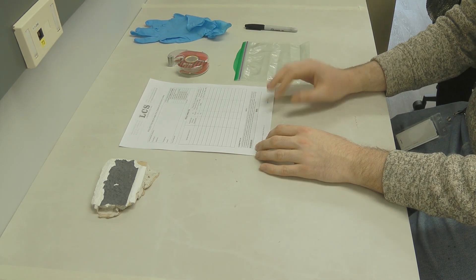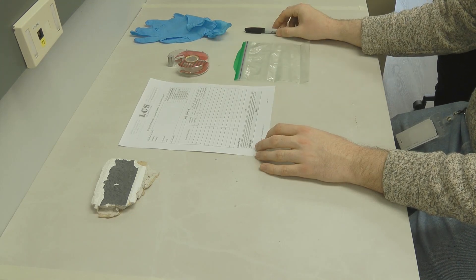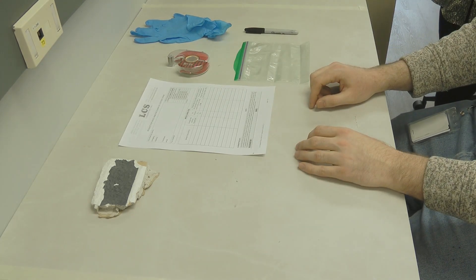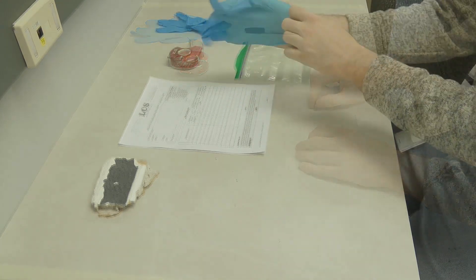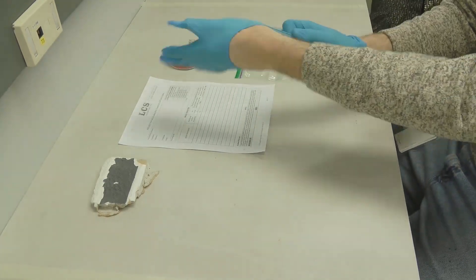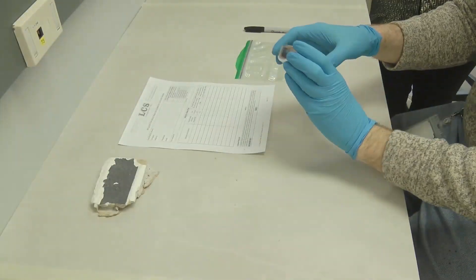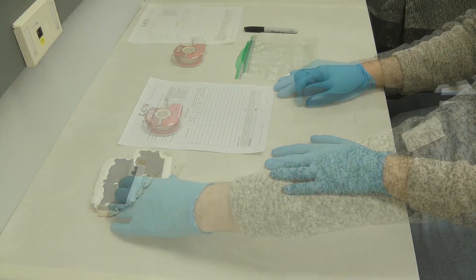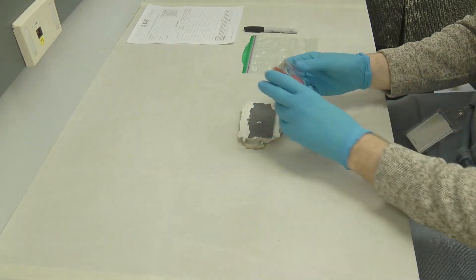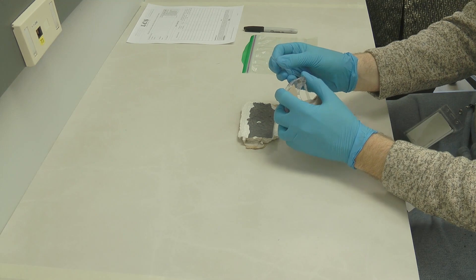The technique is very simple and all we need are a clean ziplock bag, transparent tape, and a marker to label your samples. Please use a transparent tape which has the word transparent written on the dispenser. It is important that you use transparent tape, so please avoid using any other tape like packing tape or scotch tape.